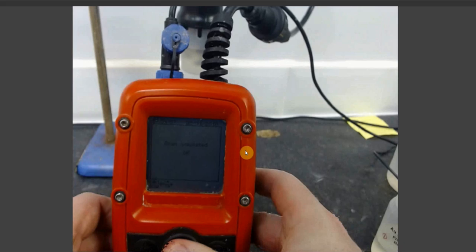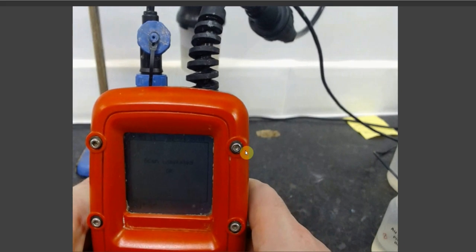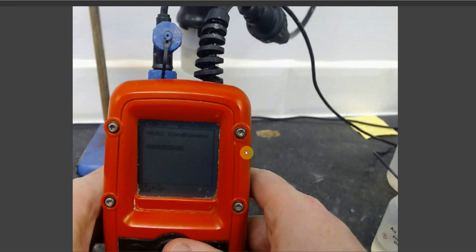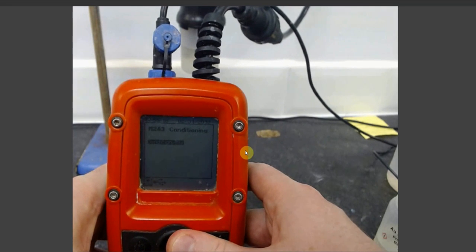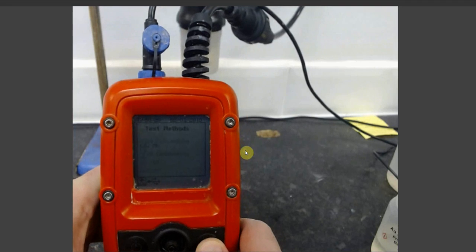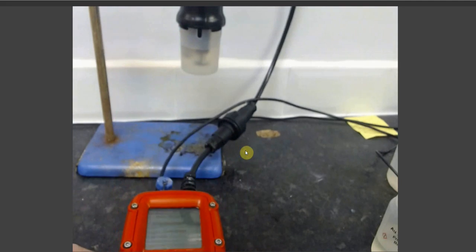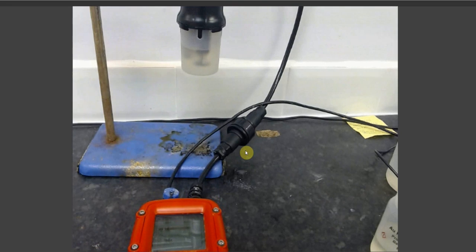Once your Metalyser has finished the process, it will simply display a screen saying scan completed. Simply press select to return to the M2 and 3 conditioning step and use the cancel button on the right hand side of the Metalyser to return to test methods. You will now have a thin gold film deposited onto your WE2 electrode and will be ready to continue onto either a mercury analysis or an arsenic analysis.